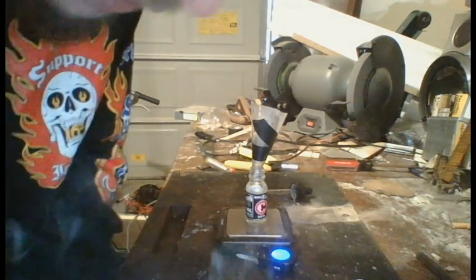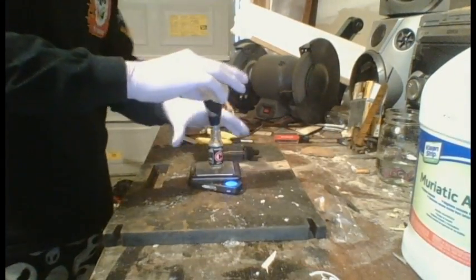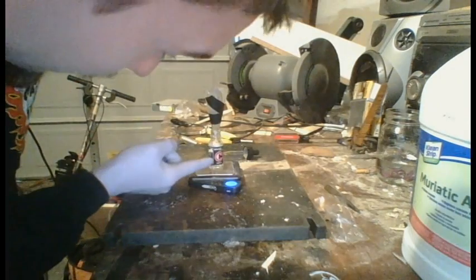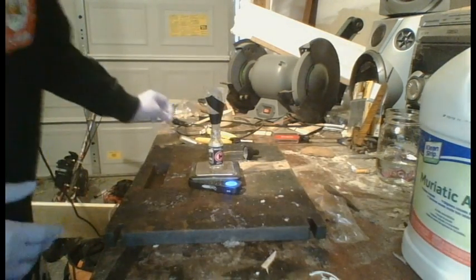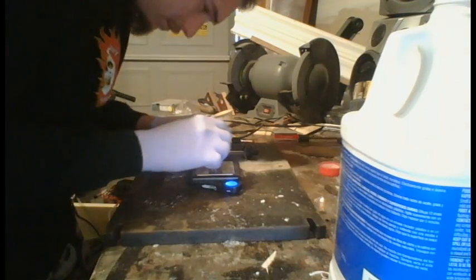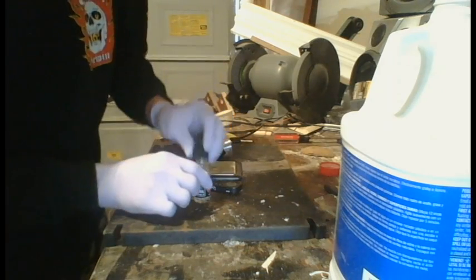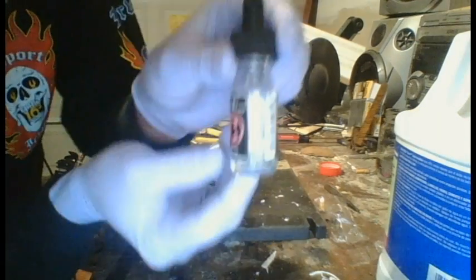I'm going to back up my camera a little bit just in case there's a spill. I'm only going to add enough to maybe cover the solder for now — I just want to test this solder to see if it's going to work. I'm going to give it about a day or two to dissolve in the solution. I actually accidentally added a bit more than I had intended, as I can see here.